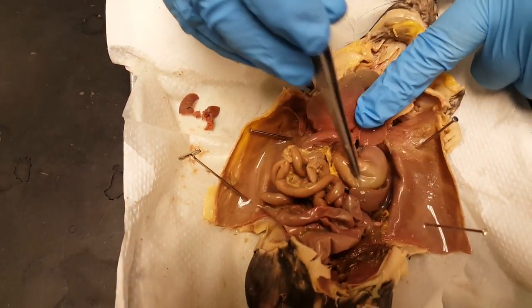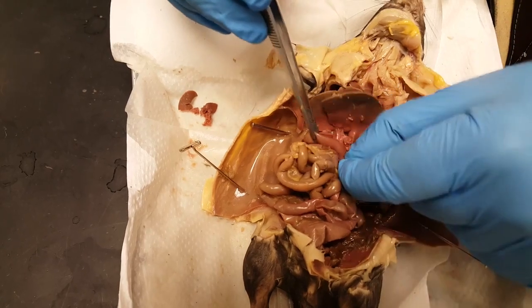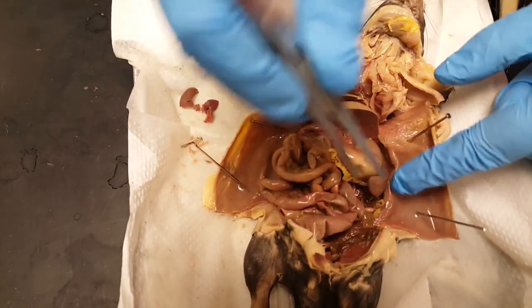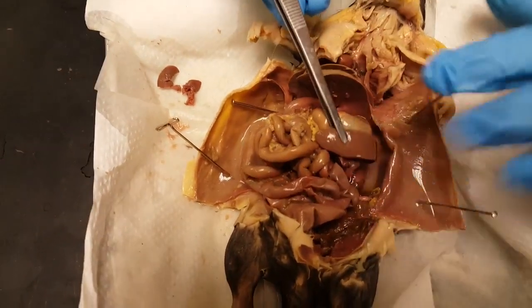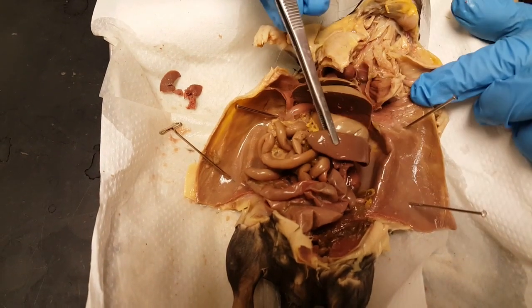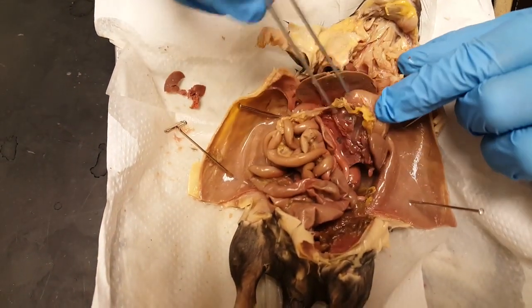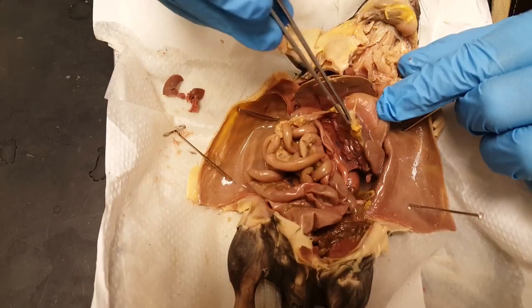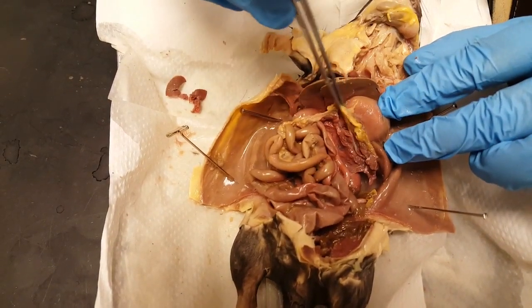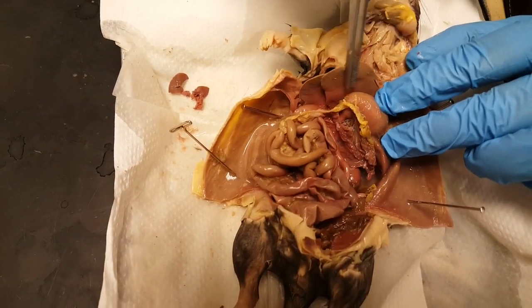Then the stomach curves around, and the first section is the duodenum. Now while we're here, this thing that kind of looks like a finger that goes across the stomach — that's the spleen. And this bumpy yellowish stuff is what remains of the pancreas, which is a gland, and it doesn't preserve very well.